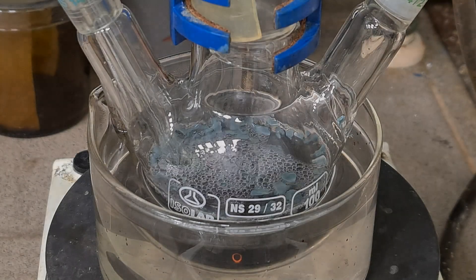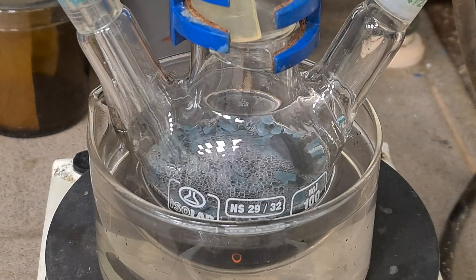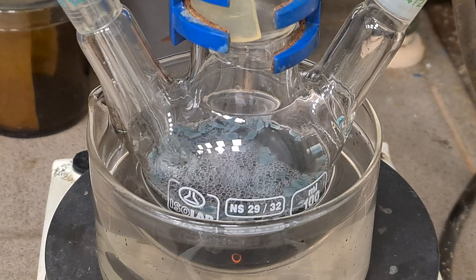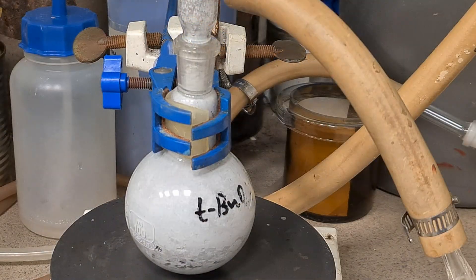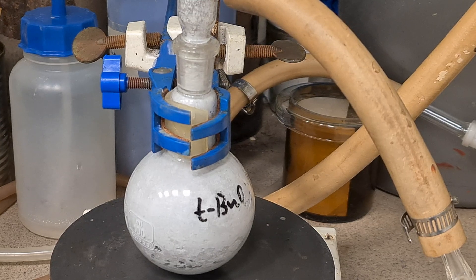Hello my dear chemists and welcome back to Akantharx channel. Today I'm going to show you how to make a very useful source of t-butoxide ion and lithium counter ions — it's lithium t-butoxide.